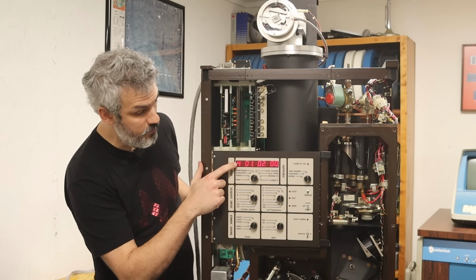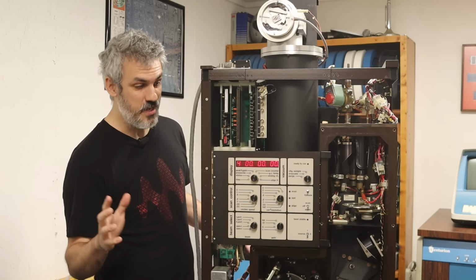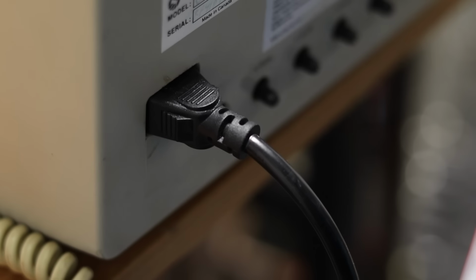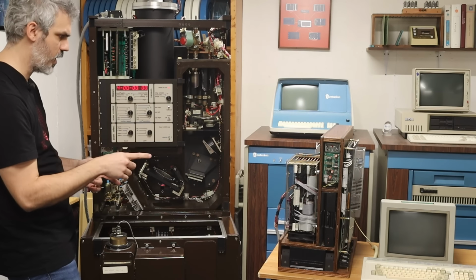Yeah, so we're in mode 4. That's already a huge improvement over what it was before. So I think our next step is to turn the PDP-11 on and see if it doesn't go crazy again. Okay, the PDP-11 is still not on. All I did was plug in the monitor.